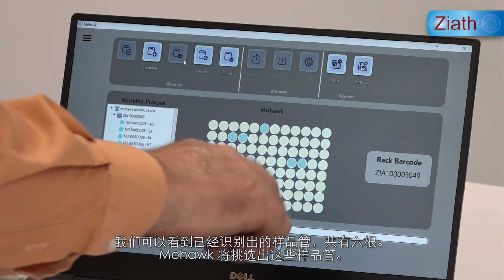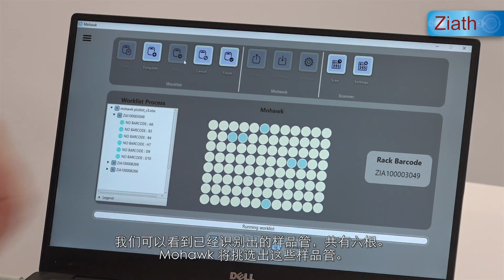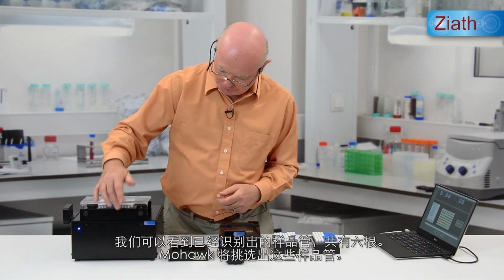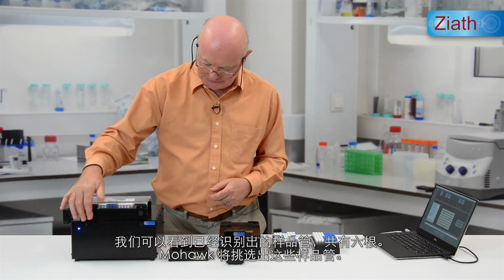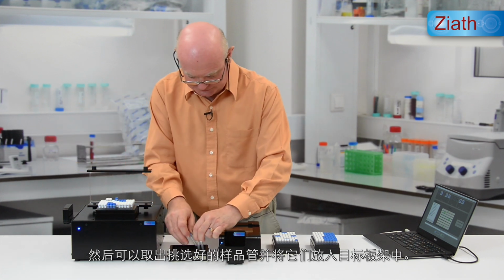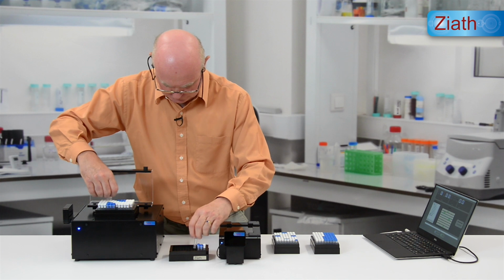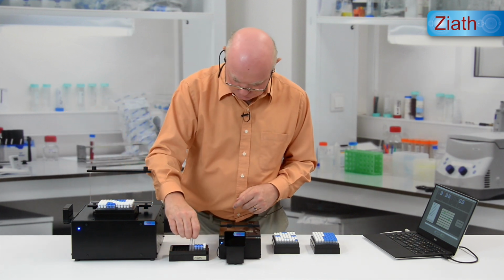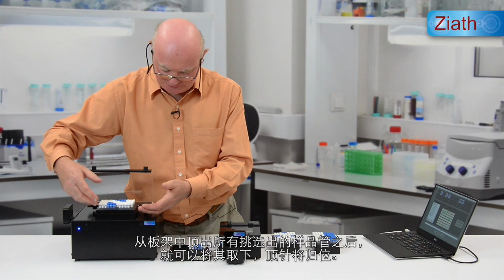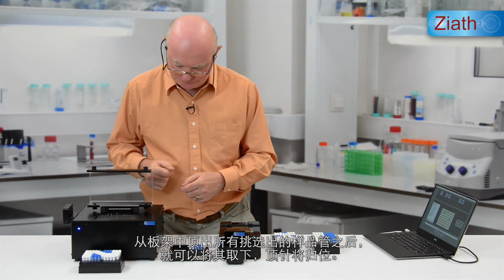So here we can see the identified tubes. We've got 1, 2, 3, 4, 5, 6 of them, and those tubes will then be picked from the Mohawk like that. The picked tubes can then be removed and put into the destination racks. Once all of the picked tubes have been taken from the rack, that rack can be removed and the pins will drop.